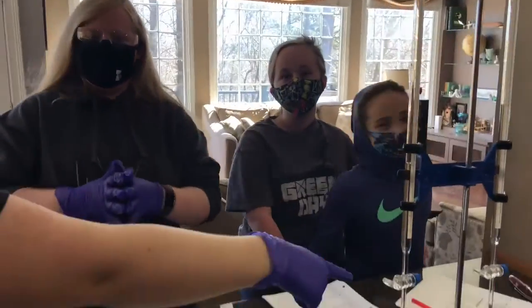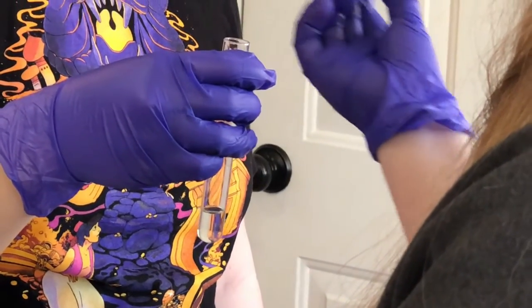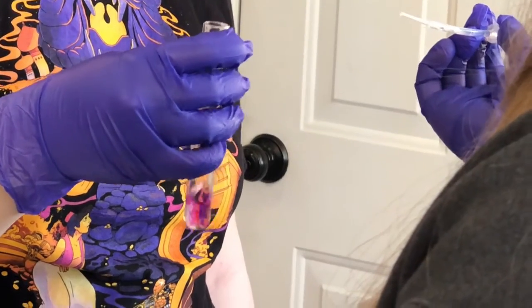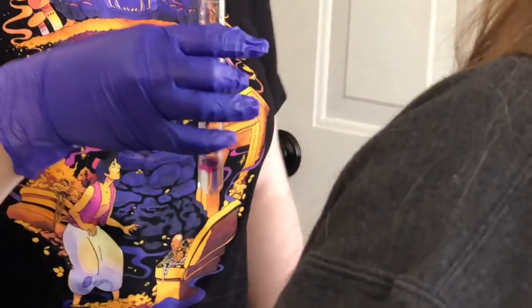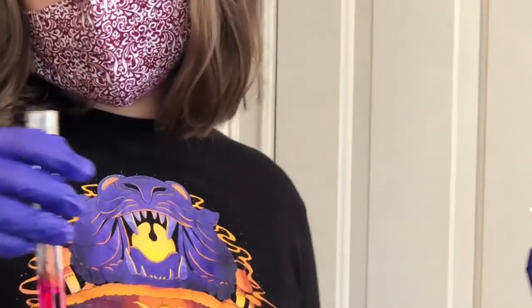Yeah, you girls are going to want to watch because this part's the fun part. About there. Almost. What in the world are y'all doing? I don't even know what they're doing. But Miss Danny. There you go. 24. 24.